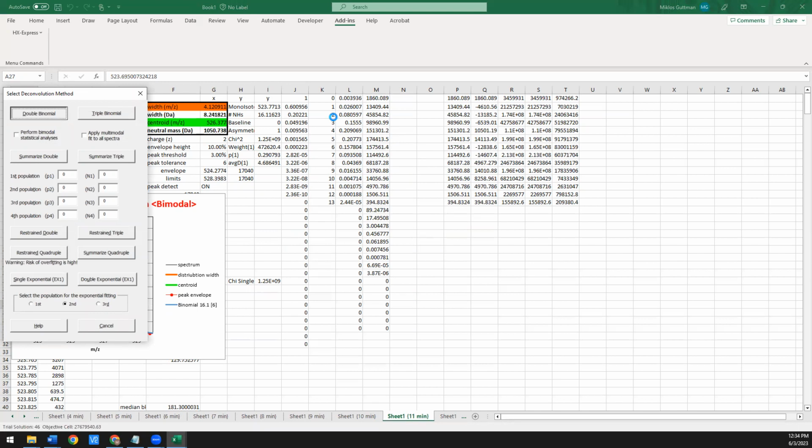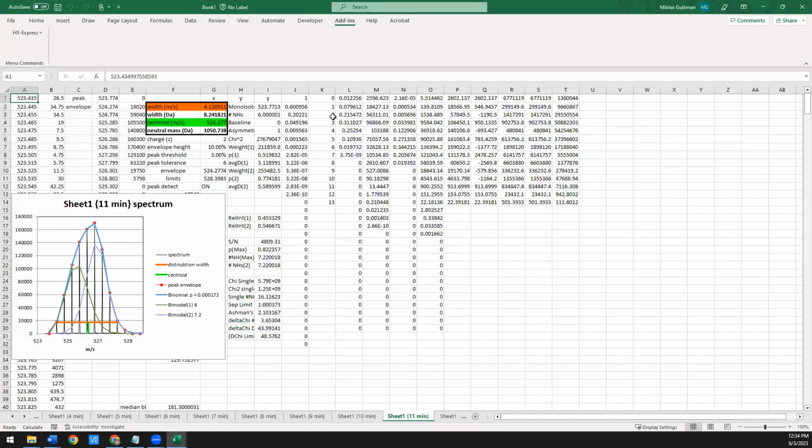but we might not necessarily be able to trust the numbers that it gives us in terms of relative intensity and deuteration state. So here, these are the relative intensities. The green population is 45%, the blue population is about 54.6%. But you can see that they're not that well resolved. There might be a whole bunch of ways to fit two populations in there that are almost just as good of a fit. And anytime you're in this scenario, you lose confidence in terms of how accurately you've really pinned down these numbers. So to address this, we built in another function.